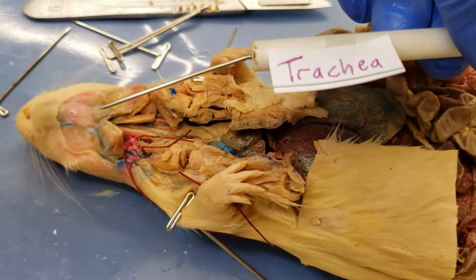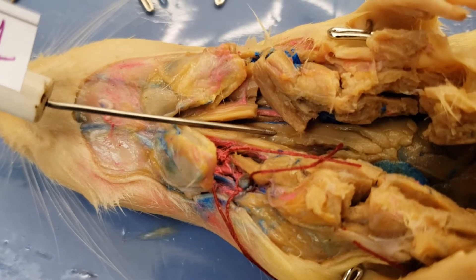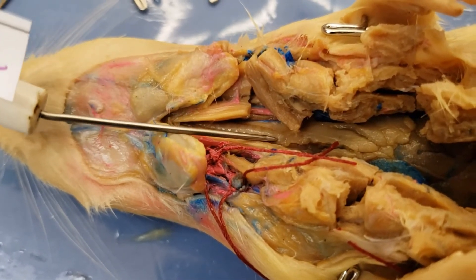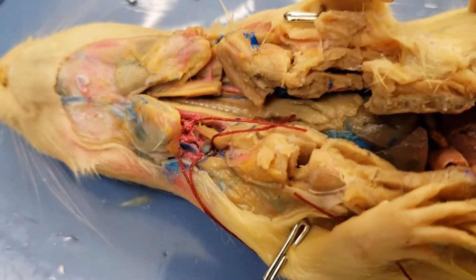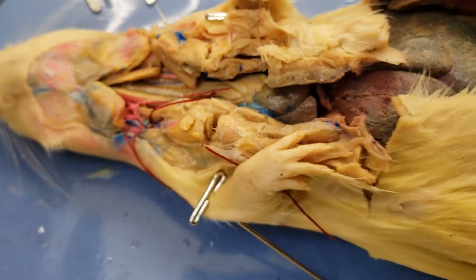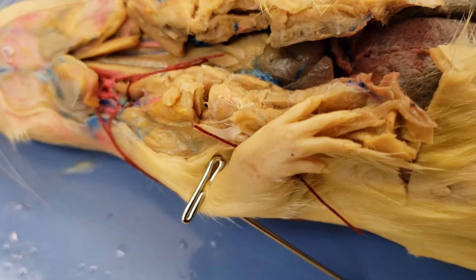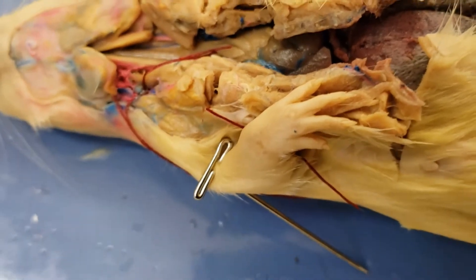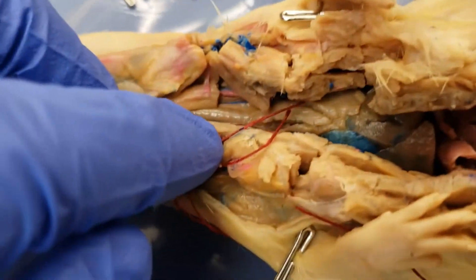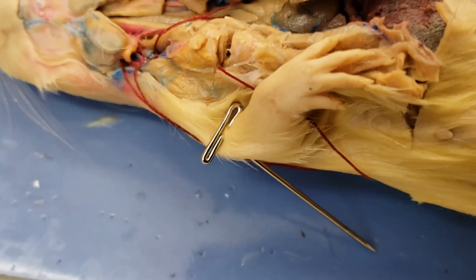That is the trachea. If you take A&P 2, you'll learn more about the trachea, but it's a key structure involved in the respiratory system. Those rings that it has — if you actually feel it, it's hard. A lot of tubes, when they're empty, will flatten out. But the trachea's job is to carry air, so it's always going to be open. If it weren't for these rings that hold it open and keep that shape, the trachea would collapse and you couldn't breathe.